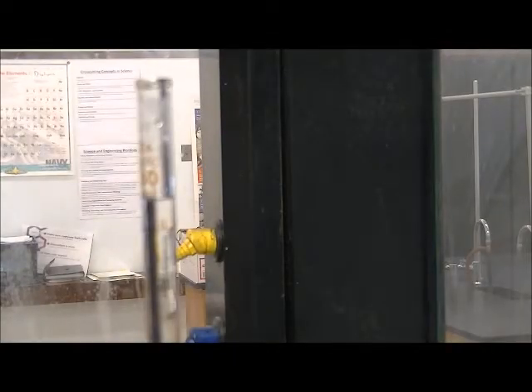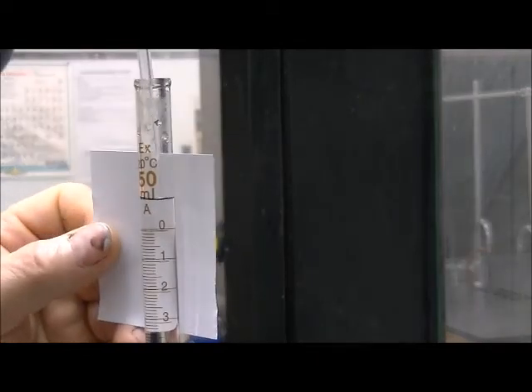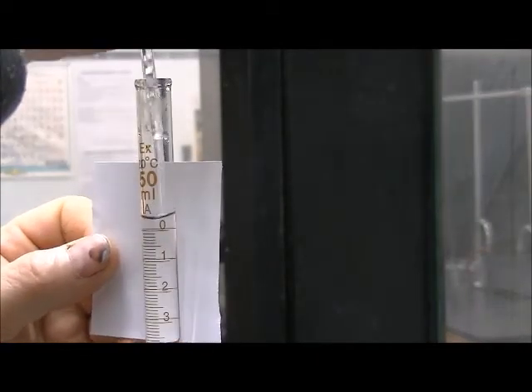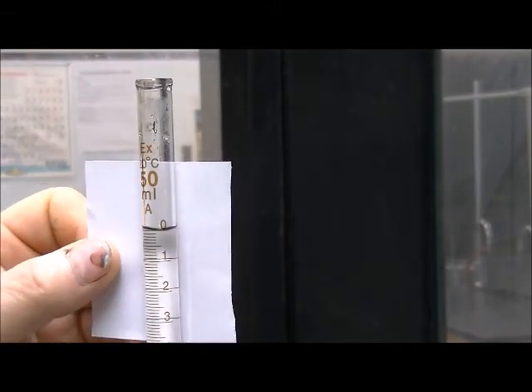So now the burette has been rinsed. I opened the valve to fill it with titrant. And I'm adjusting it to zero now before I begin my titration using a pipette to set it right on the zero line.